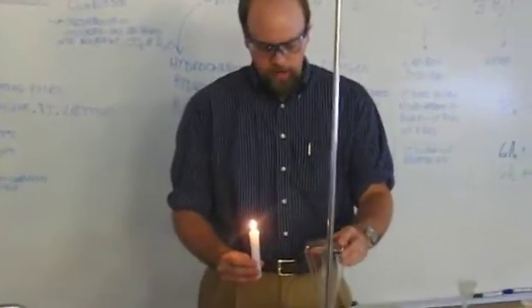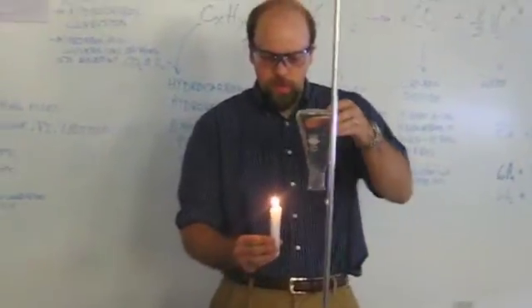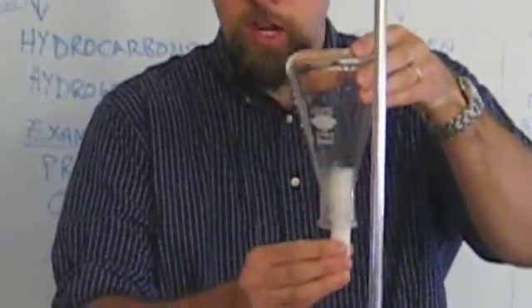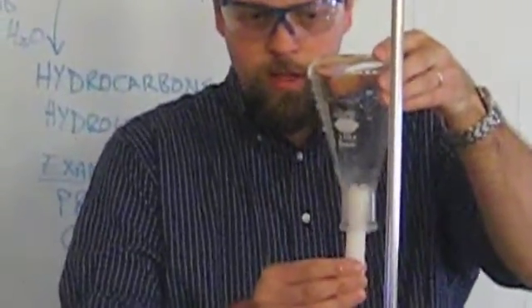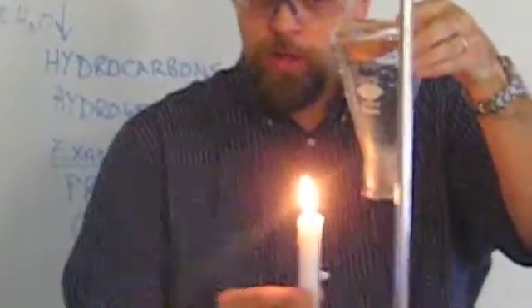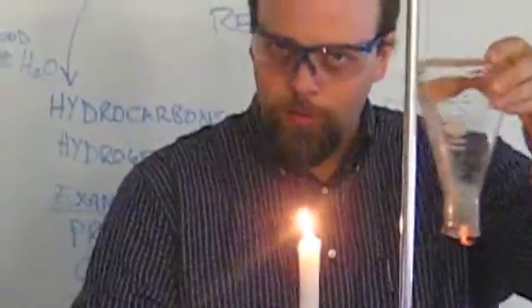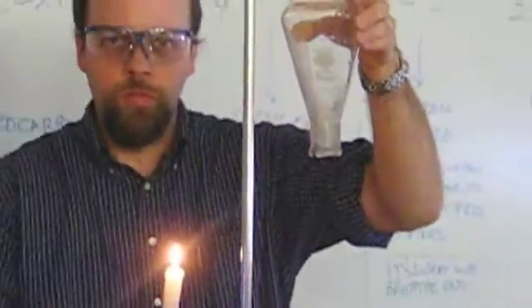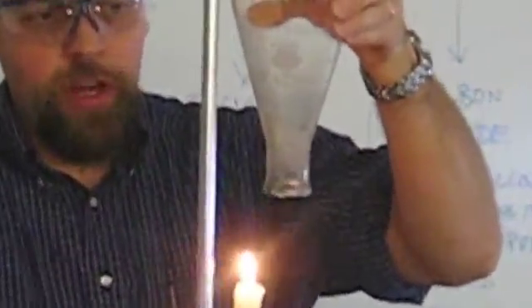All right, so now we have a flask full of hydrogen gas. I'm going to bring this flame near to it. It's going to do that. And you can see that the hydrogen gas is not flammable, or at least it doesn't allow the candle to burn, but it is in fact flammable, because if you can see it, just barely, maybe zoom in on that, there is a flame right at the very lip of this.